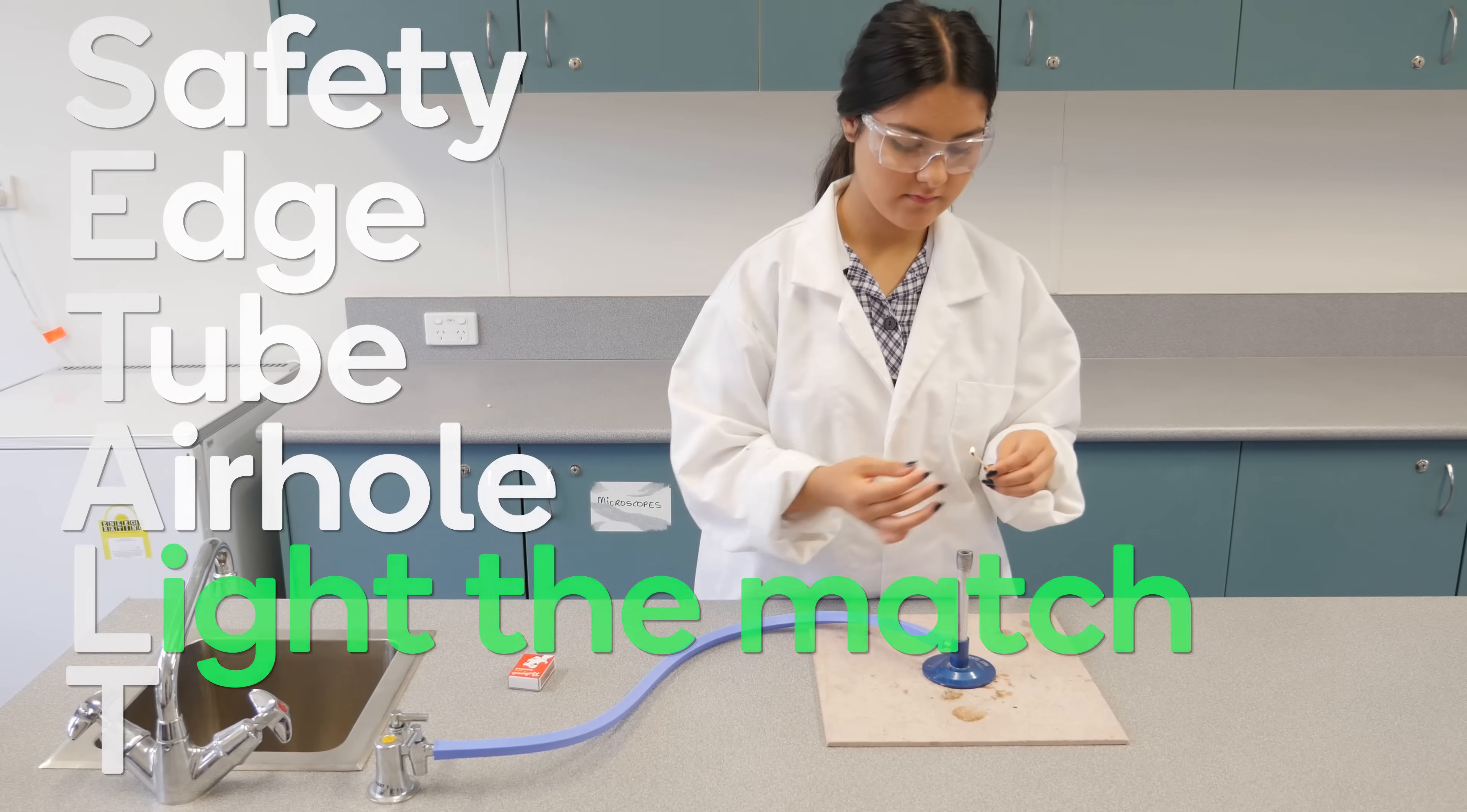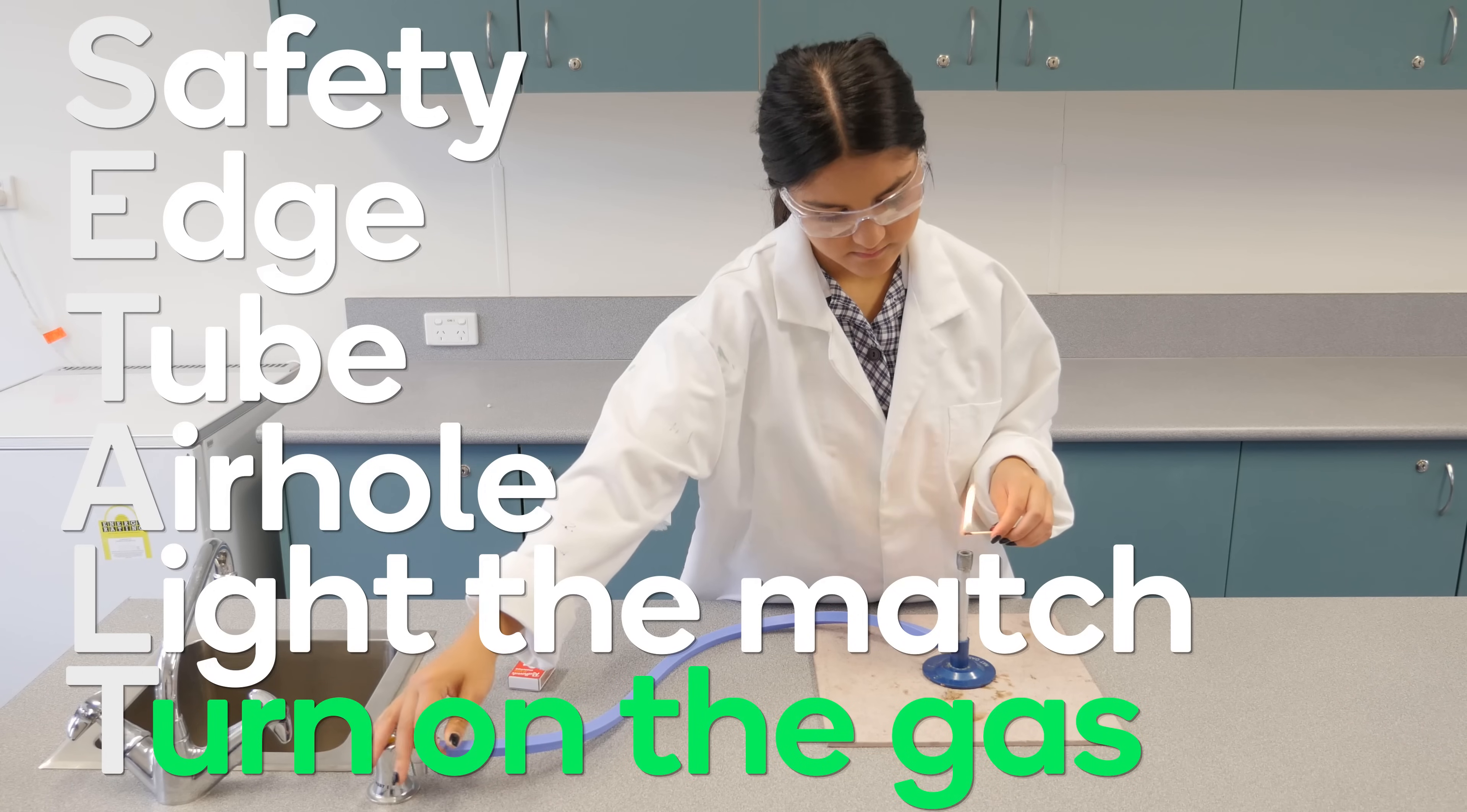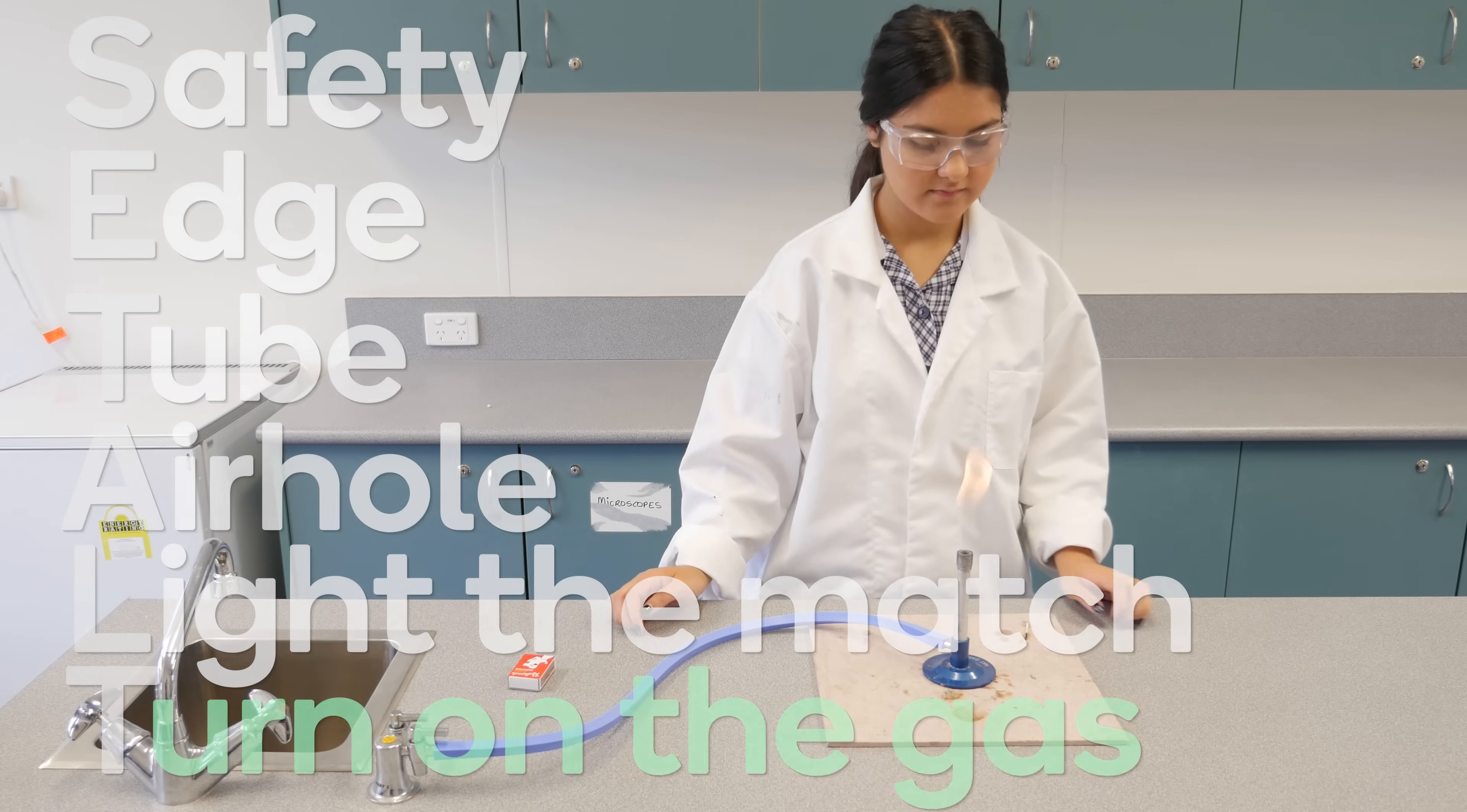You're ready to light the match and hold it above the barrel. Finally, you can turn on the gas. It's important to light the match first to avoid releasing dangerous gas into the air.